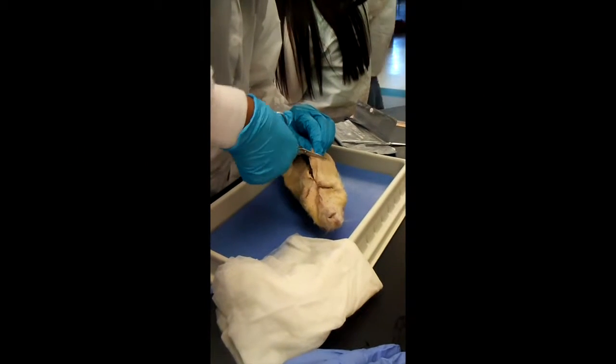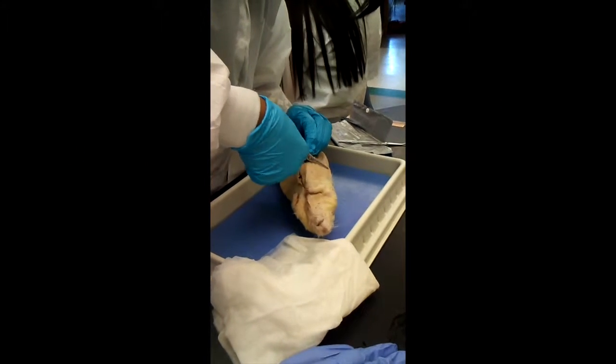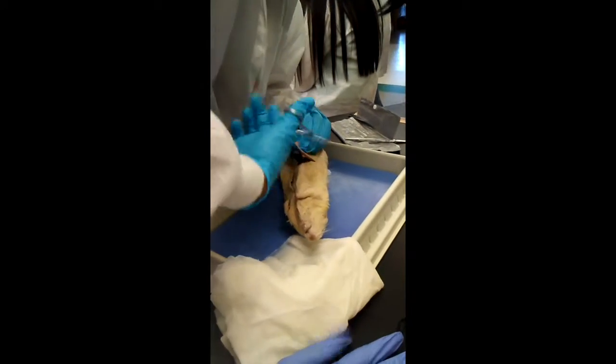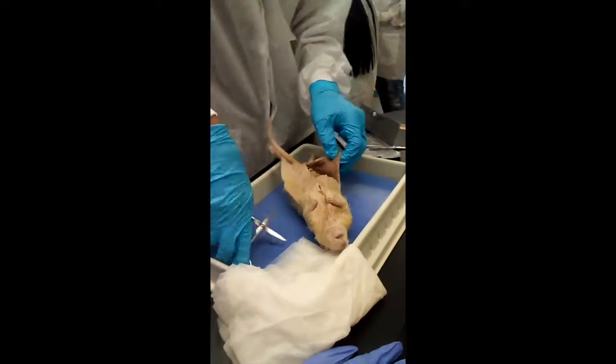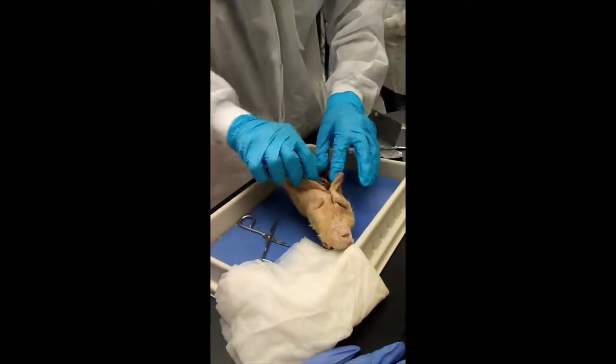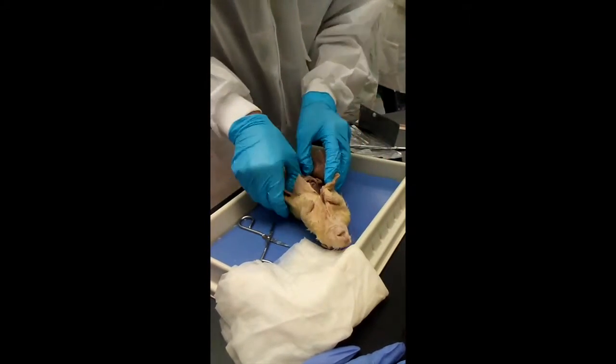Now we are going to cut from the posterior part of the rat to the anterior part as we can pinpoint the parts that are directly inside of it.